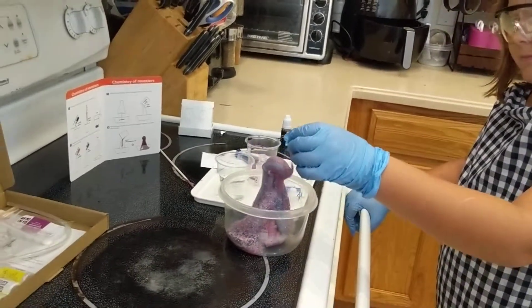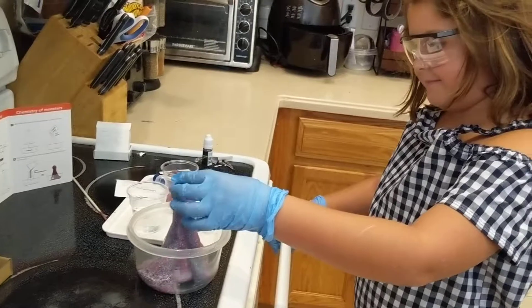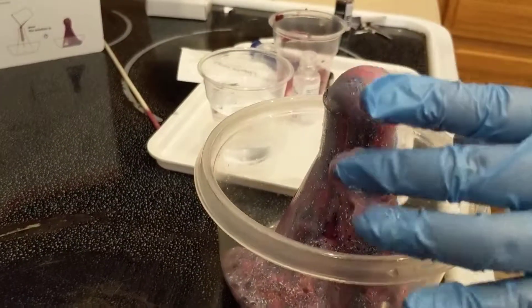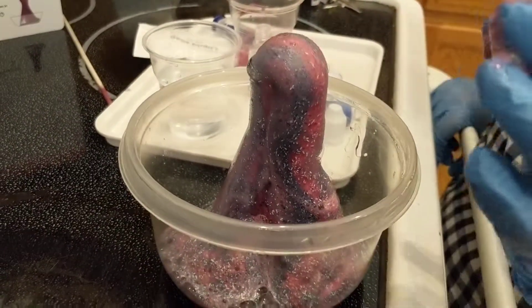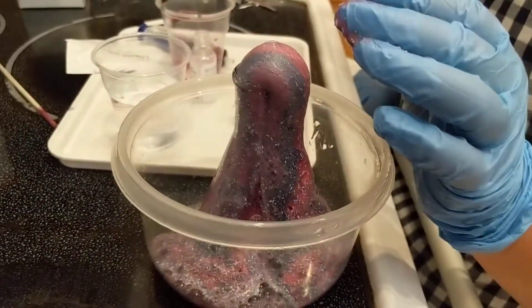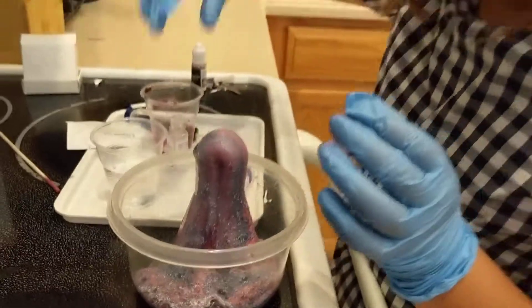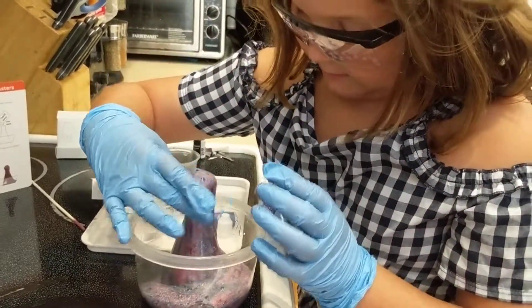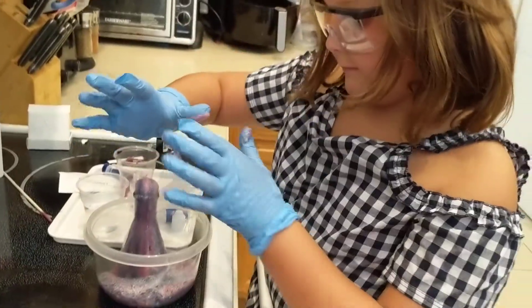Don't taste it or anything weird. Let me see. That one's supposed to get poof. Watch up, let me see it. It looks like a galaxy. Yeah, it does look like a galaxy, huh. I'm gonna turn it so it doesn't matter. Yeah, just turn the bowl, turn the whole bowl. Oh, she wants it to fill.